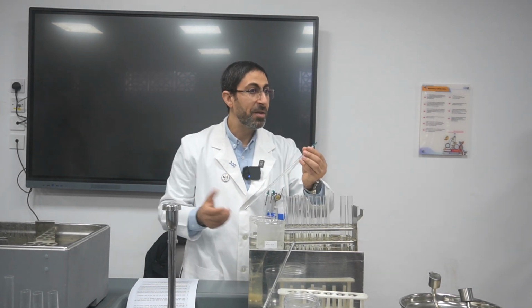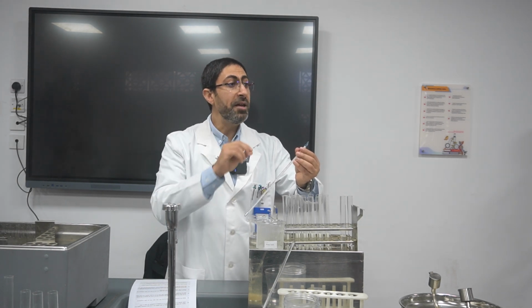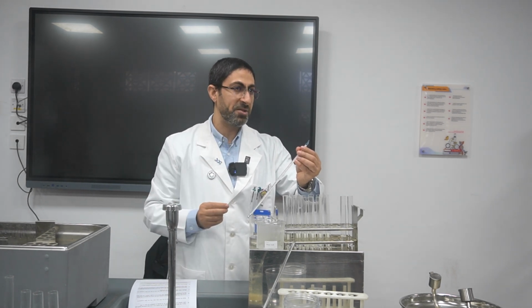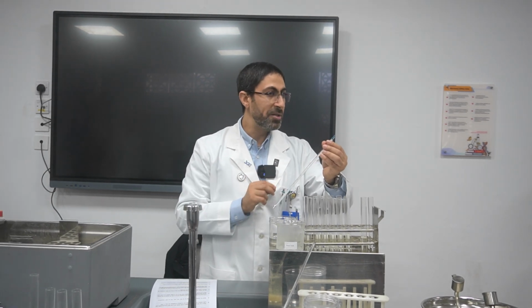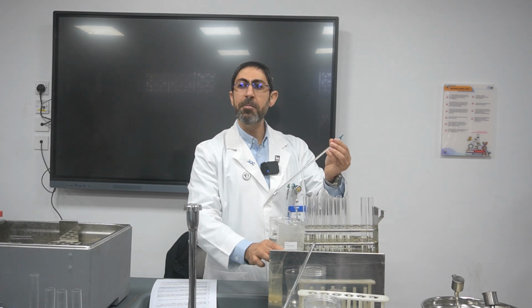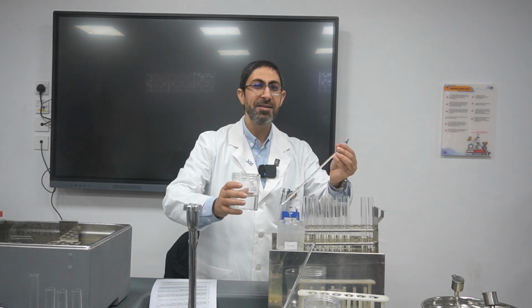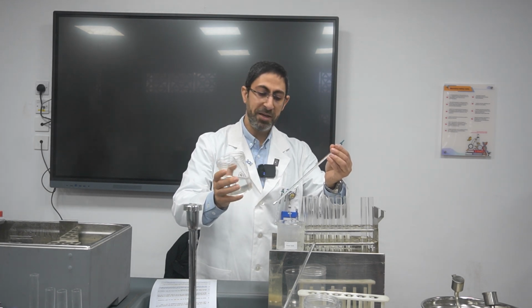You got the point? Then I can make more than one run at the same time. Each one has to be for about 20 minutes. You have to wait for 20 minute intervals. So let's get started. Here the temperature is 100 degrees C. I have to add tap water.